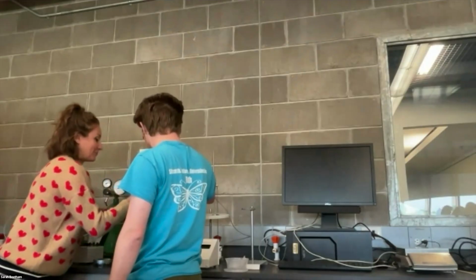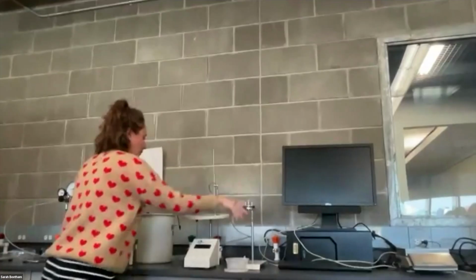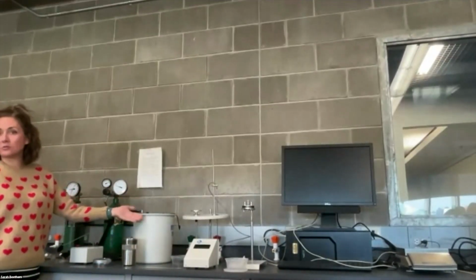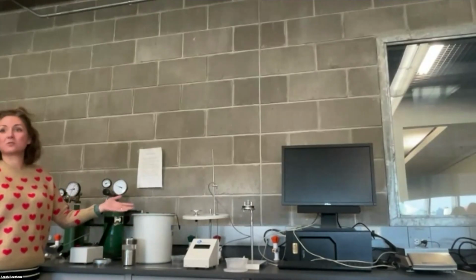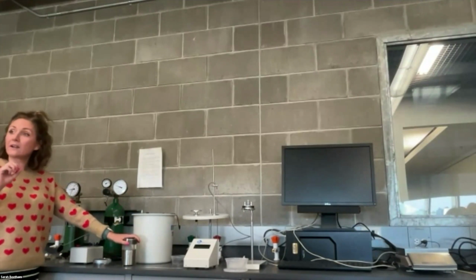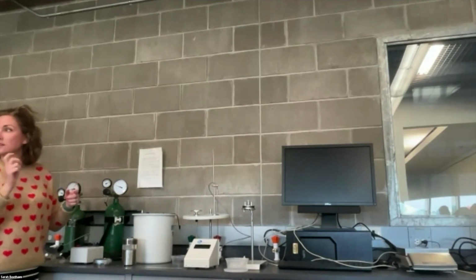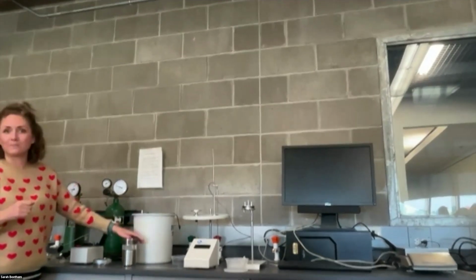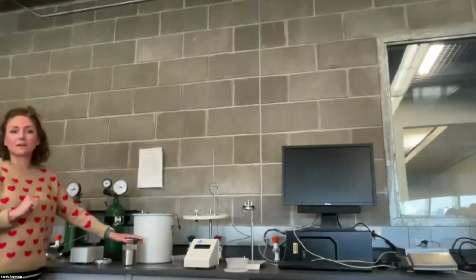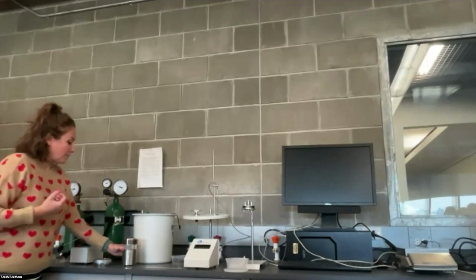Here, let me take that over here. Thank you so much for your assistance. So we're gonna just put this back to where it was before. If you find that when you open this up, there is still food sample in there, that is not good. So that means you'll have to repeat it. That happens if, you know, you don't have good contact with that fuse wire. If the food sample is entirely unburned, that means that the fuse wire was touching the little cap and it just shorted out. Okay. So we have enough food samples in the event that that happens. Hopefully it doesn't. But if it does, don't panic. It'll be fine. You just have to try again.